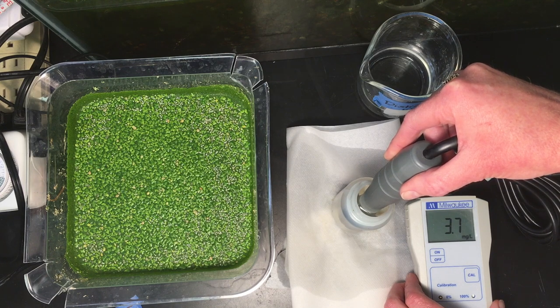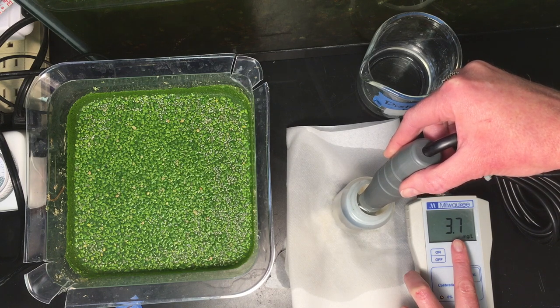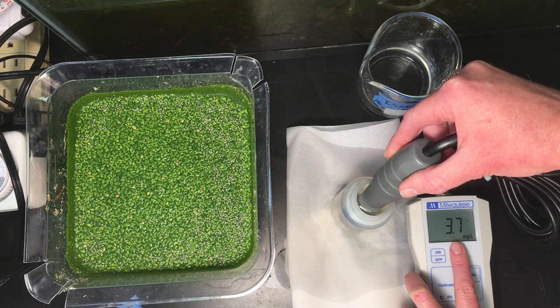Alright, so after a minute you can see that our reading here is 3.7 milligrams per liter.